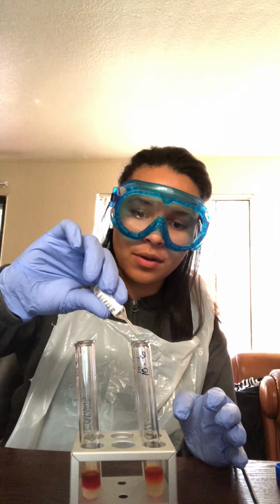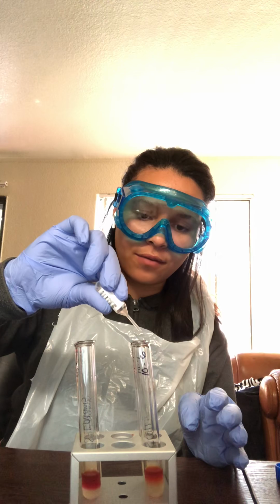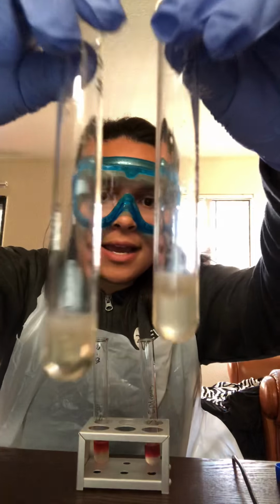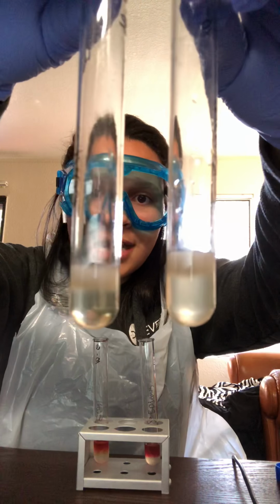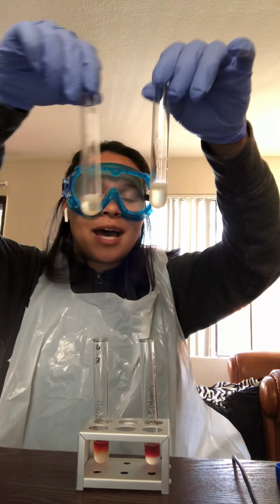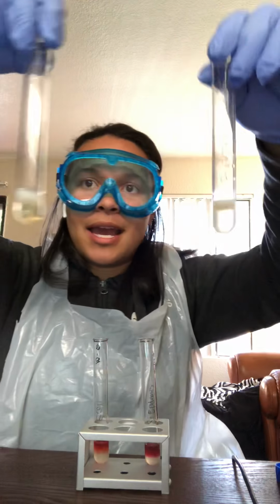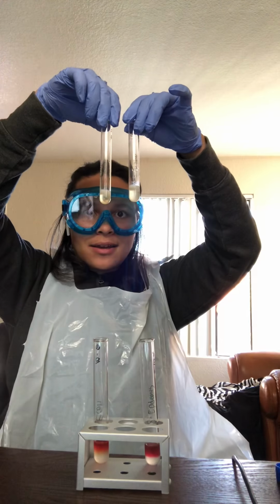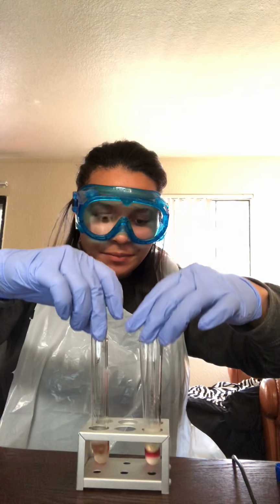So I'm going to start. 1, 2, 3, 4. 1, 2, 3, 4. And that's it. Interestingly, my results for the Barritt's B and A, as you can see, it was cloudy at first and it began to clear closer to the bottom and it's cloudy at the top. So it made some type of layer to the S. epidermidis here and the E. coli here. And it seems like the longer I let it sit, the more clear it gets.